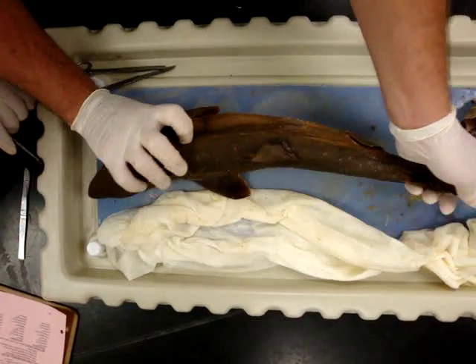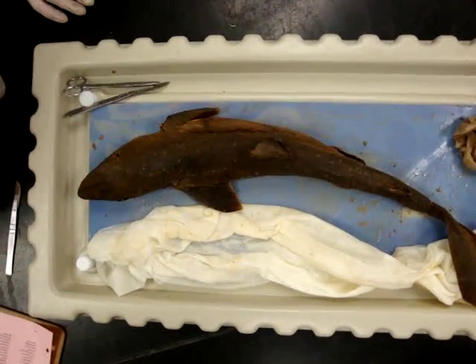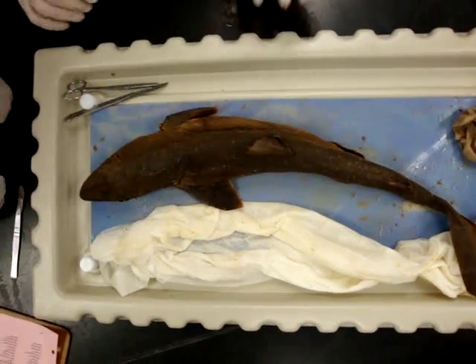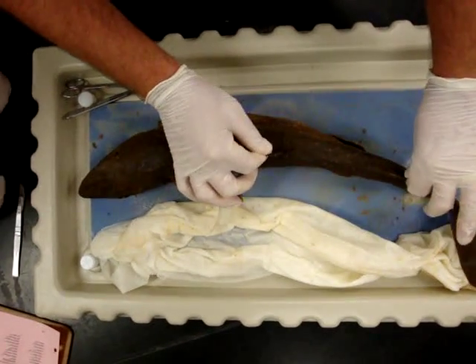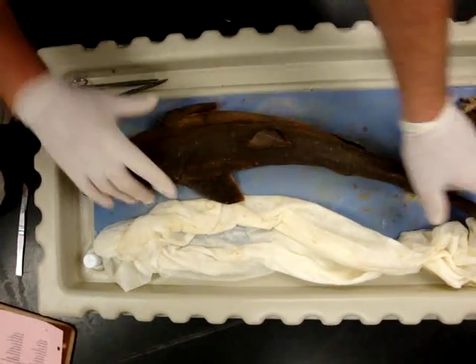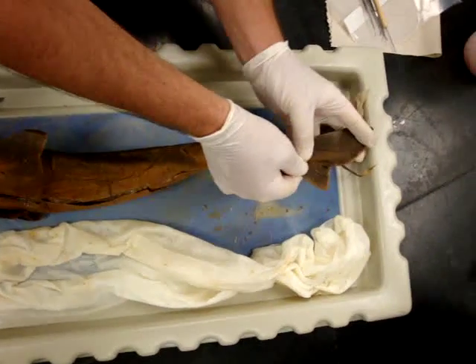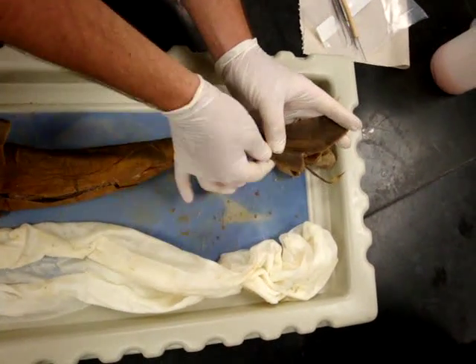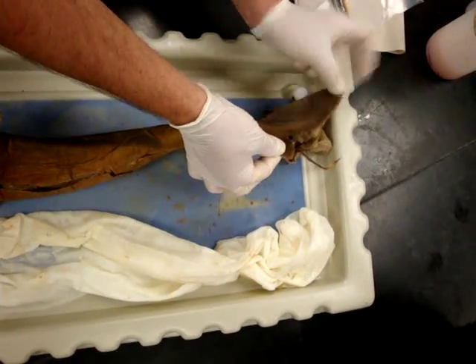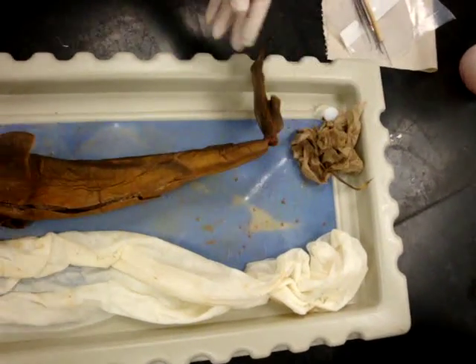Working on the dorsal side, doing some external structure. You'll notice that I started the dissection without a scalpel in my hand. Here we have a pair of dorsal fins, and here we have a caudal fin. The caudal fin is on the tail. We have a specific name for this kind of tail — it's called a heterocercal tail. You can see the top lobe is bigger than the bottom lobe; the dorsal lobe is bigger than the ventral lobe. We refer to that as a heterocercal tail.